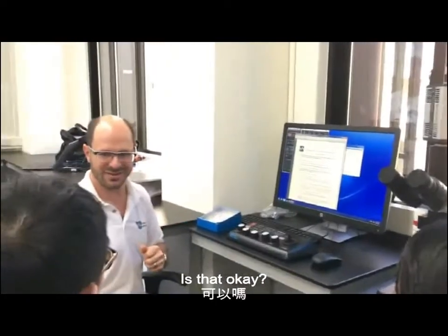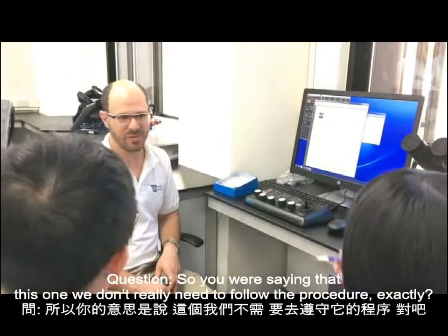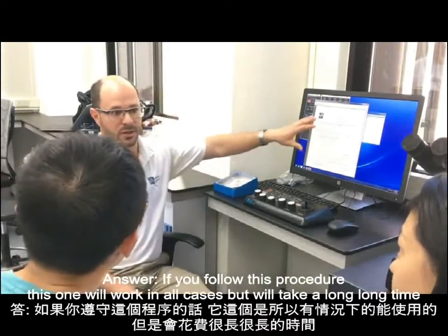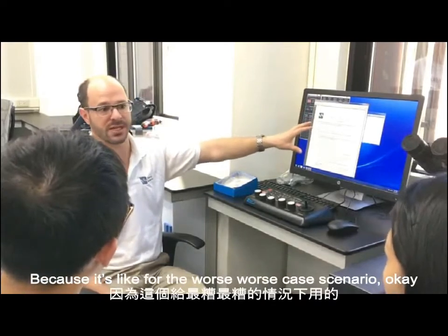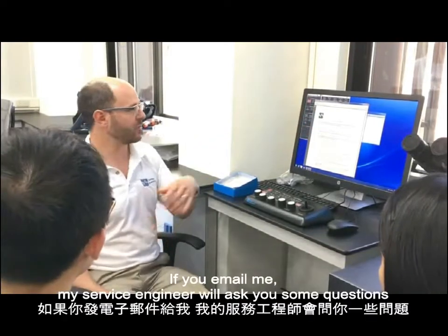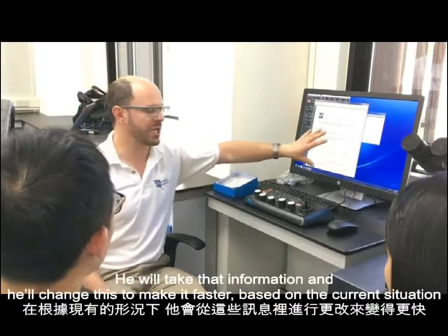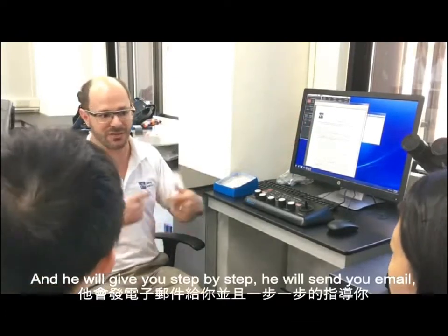Is that okay? So this page is going to be about conditioning the cathode. So you were saying that we don't really need to follow the procedure exactly? If you follow this procedure, it will work in all cases, but will take a long, long time because it's for the worst case scenario. If you email me, my service engineer will ask you some questions. He'll need some information from the microscope. He'll take that information and change this to make it faster based on the current situation, and he'll give you step by step instructions.